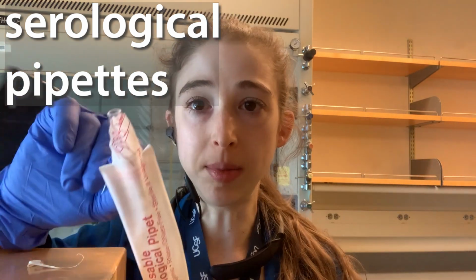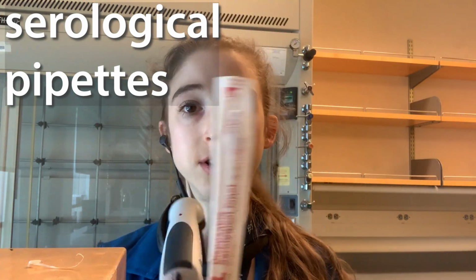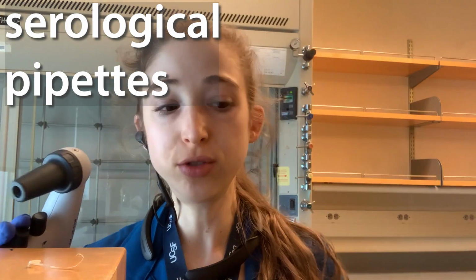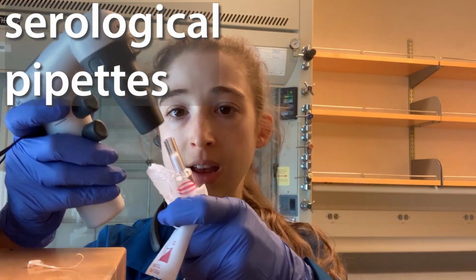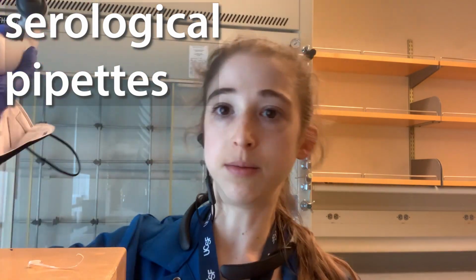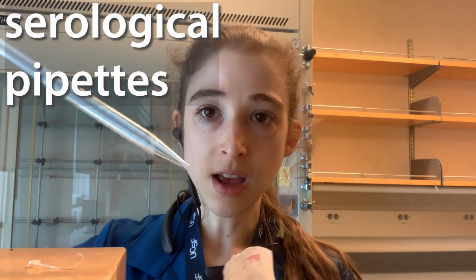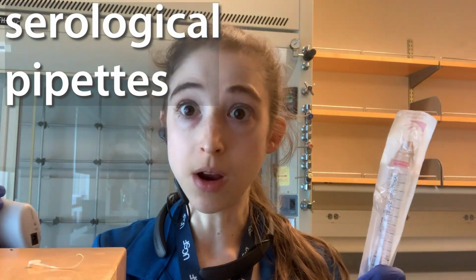So open the side with the plug, but only after you've gotten everything else ready. When you're finally ready to pipette, you've got all the tubes loosened and everything like that, then you can push open, push out, and pull it directly out, not grabbing it all and waving it around. When you're done, you can then put it back in its home. Voila.